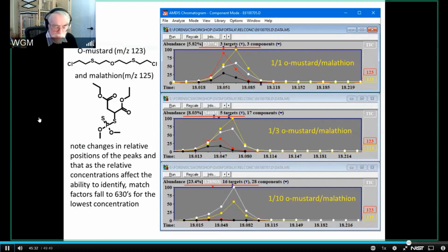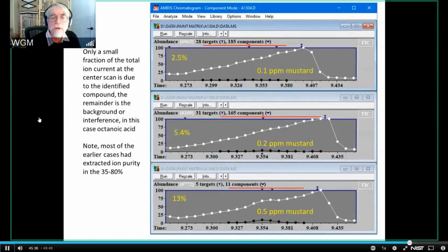the target compound. And just to close on, I've got another situation where I've got a huge background here, and this happens to be octanoic acid, so it has a typical acid chromatographic shape. This is an extract from paint, and so there's a lot of organic acids in the paint. And I've got 1/10 of a ppm, 2/10 and 5/10 of a ppm of mustard.